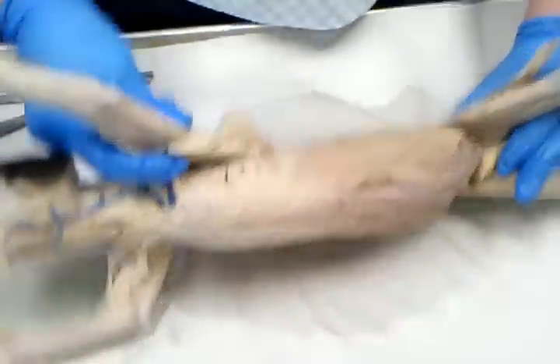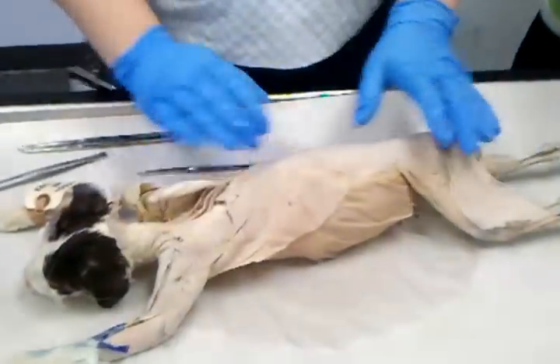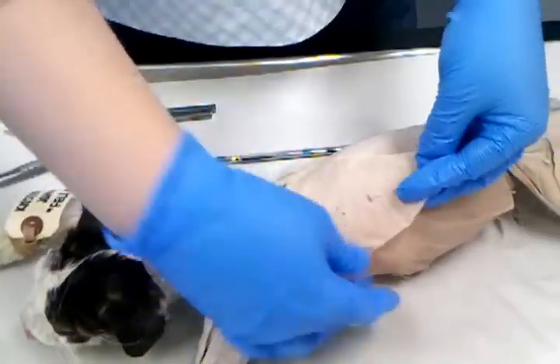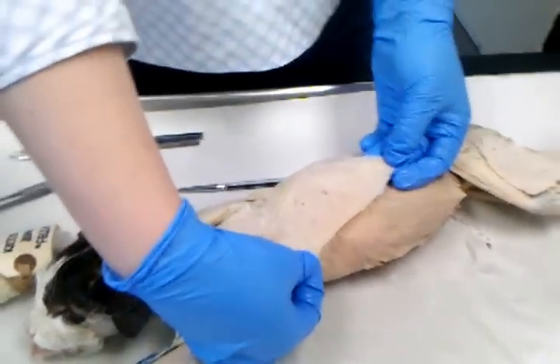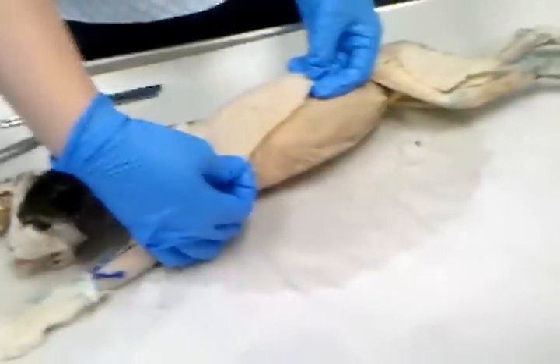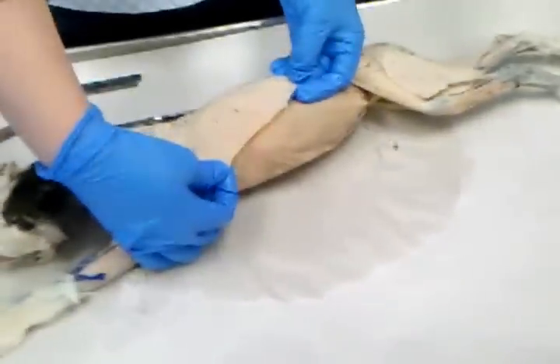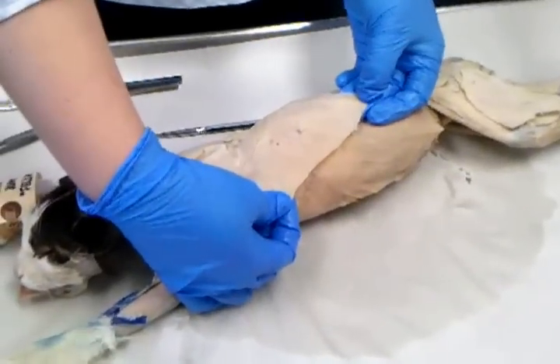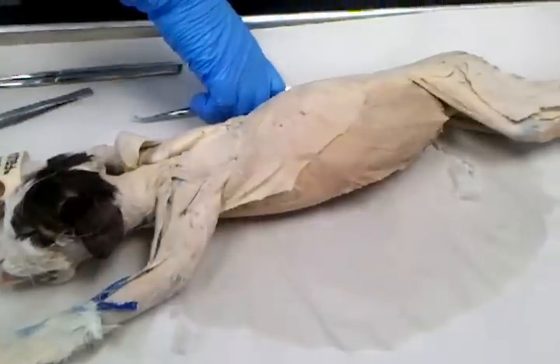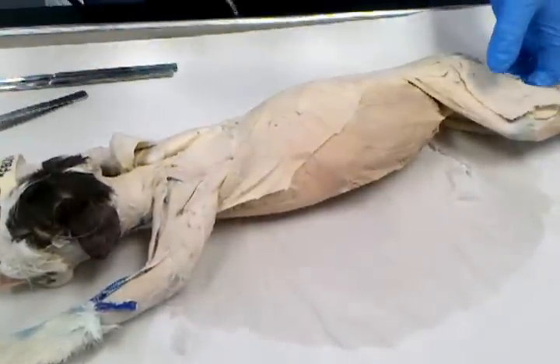Now I'm going to flip them over, and we're going to do superficial back muscles. The largest superficial back muscle is latissimus dorsi. It's this whole thing here. And this is the one muscle that wasn't listed on your sheet, but you need to know it, and it goes under superficial thoracic. I have it written up on the board there if you need to know how to spell it.